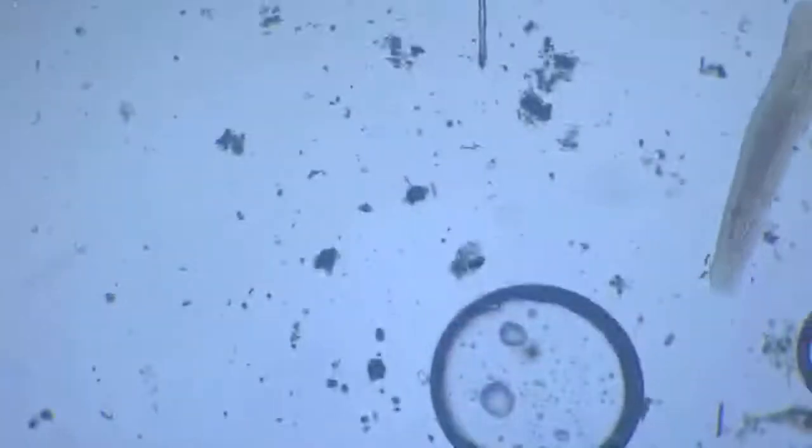Yeah, there we meet again. There we found it. It's like chasing this fellow, and you see that it has got a very smooth outline and has a darker inner constitution.